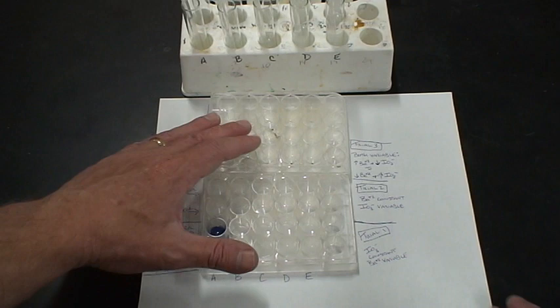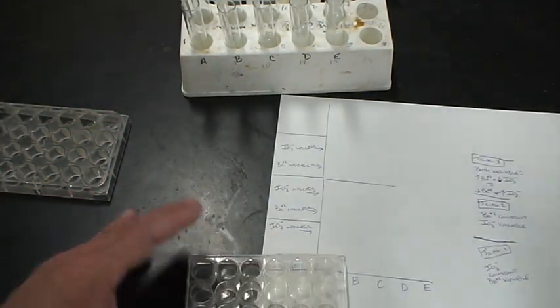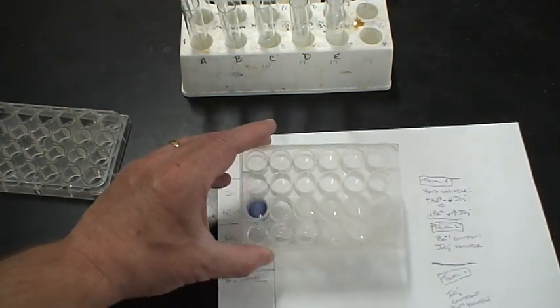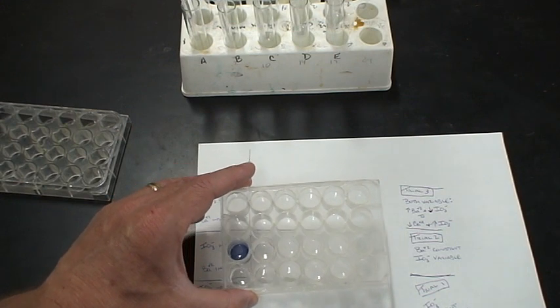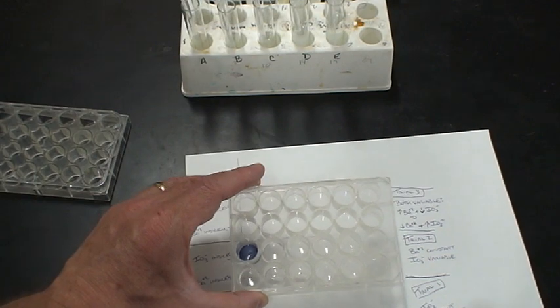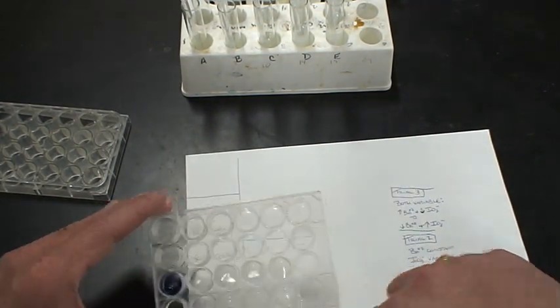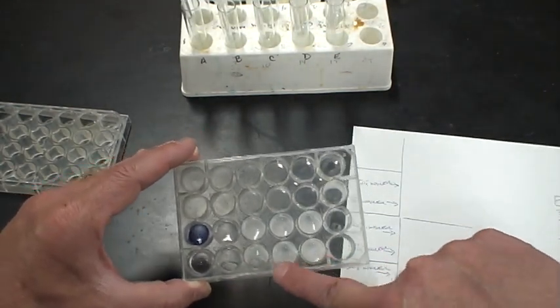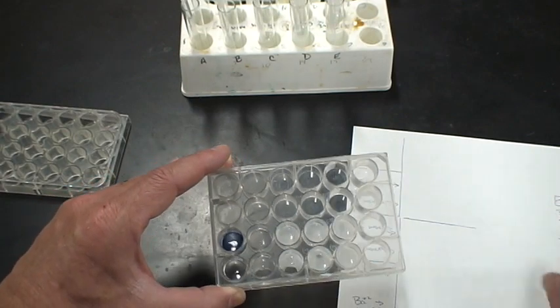Now you'll notice right away, I'm going to remove this paper for a moment, we've got some results. We see in the remaining wells that the first one turned purple, the other ones were clear. Down at the bottom, in this first column, we see that this one was clear and these turned white. This one wasn't very white, but it is white and it's definitely not purple there.